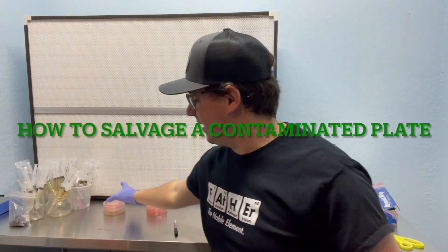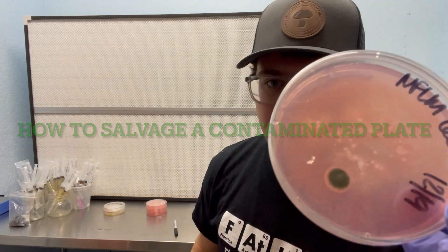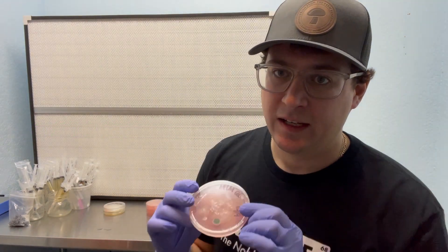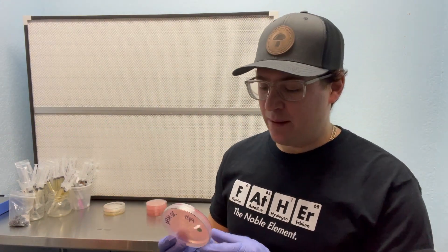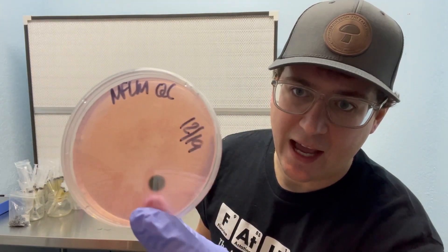What's up mushroom fam? It's Gary with Fresh from the Farm Fungi. Today I'm going to teach you how to salvage a contaminated petri dish. So mistakes can happen in the lab. This one is a lion's mane culture.